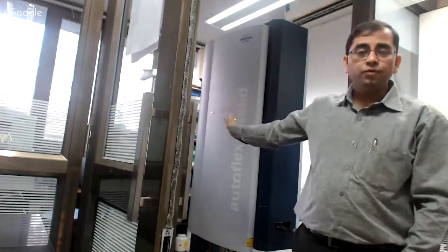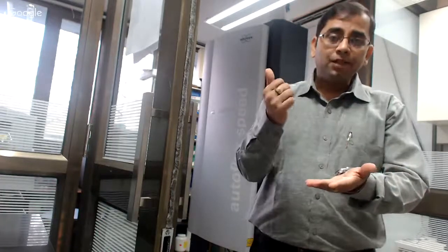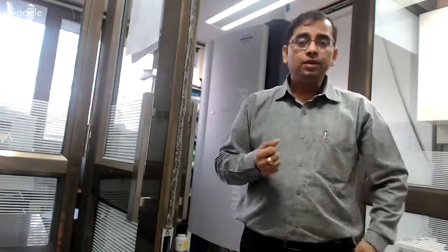So, what I really want is to involve you in some sort of discussion and gauge the interest to find out what are the pros and cons of different types of instrument platforms, different technologies. Of course, each day we cannot cover every technology, but today our intention is to talk to you about just one of the instruments here, which is MALDI-TOF. And what we have planned for you is a little bit of theoretical part, some basics which we are going to cover. Along with that, we're also going to show you some hands-on: how to take the plate and put the matrix and samples, how to prepare the plate properly, and then how to insert the plate and analyze using specialized software which we have for this kind of analysis using MALDI-TOF mass spec.